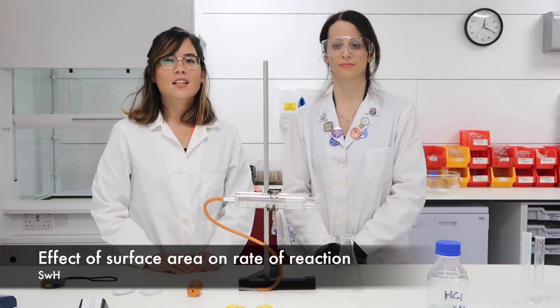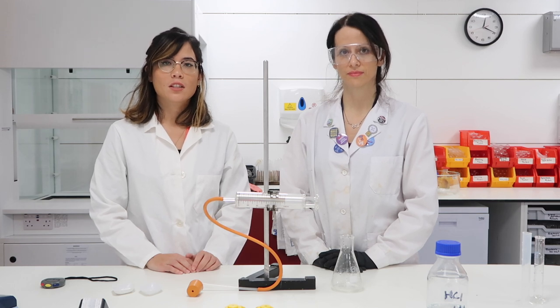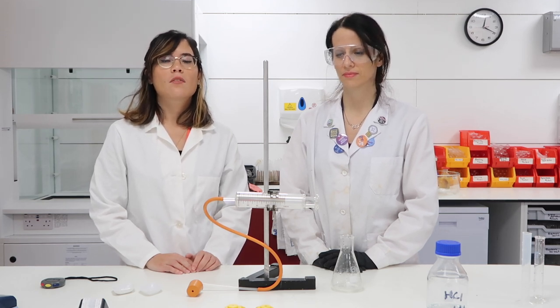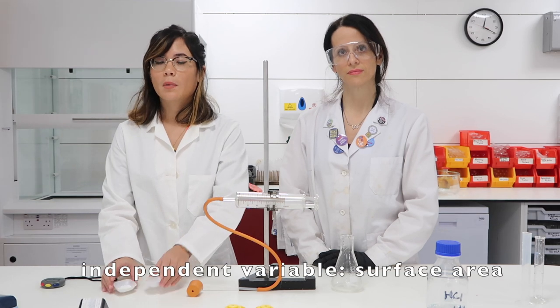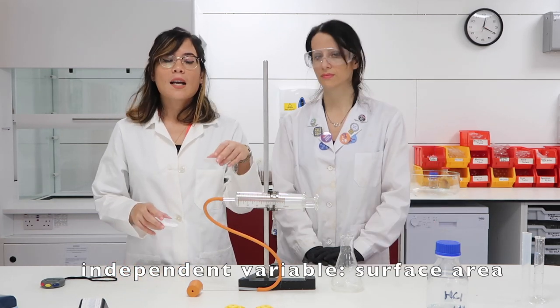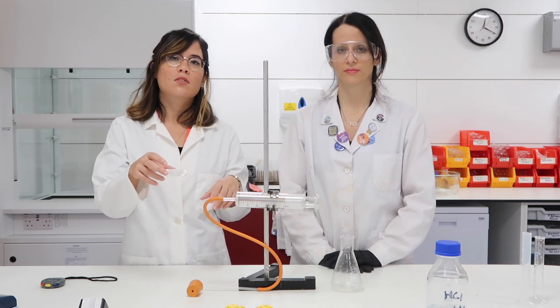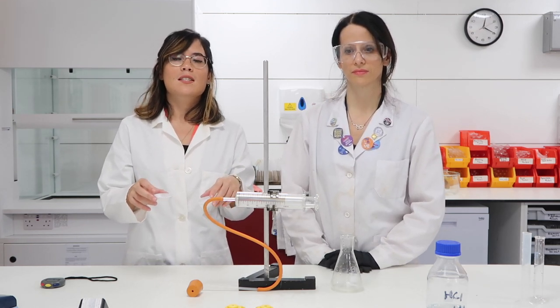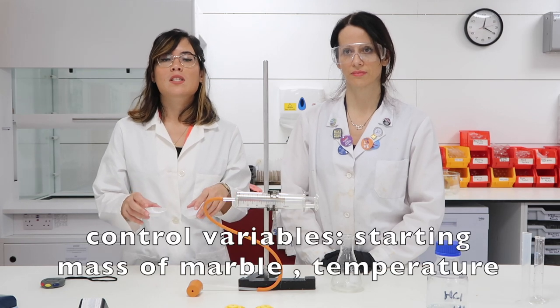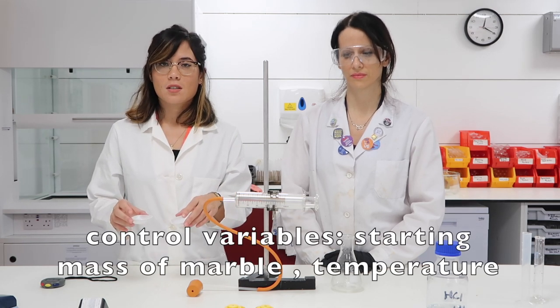In this rates of reaction video, Emilia and I are going to be investigating the effect of surface area on the rate of reaction. In terms of our independent variable — what we're changing — we're altering the surface area of our marble chips. We have calcium carbonate in chip form versus its powdered form. Notice that the starting mass of both is the same, so we have to control that particular variable: the starting mass of the calcium carbonate.